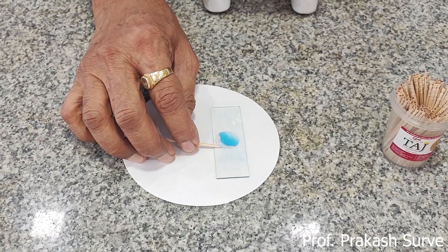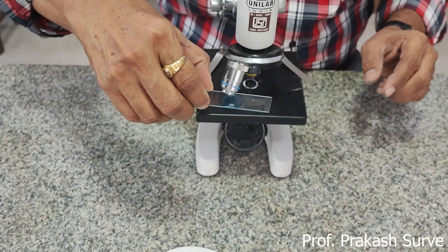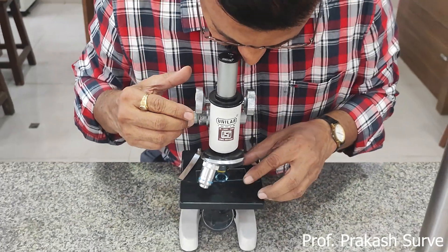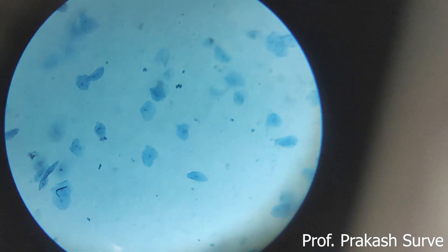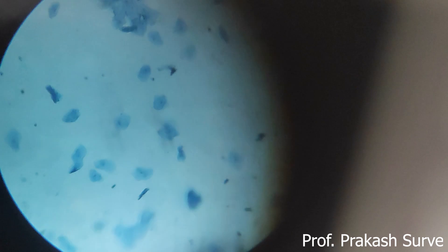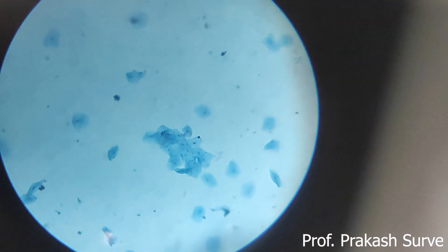Now put the cover slip on — slowly release it to avoid getting air bubbles. This slide will be observed under a compound microscope at 10x power. Adjust the light and maintain the distance. You can see that a number of squamous epithelial cells are visible.